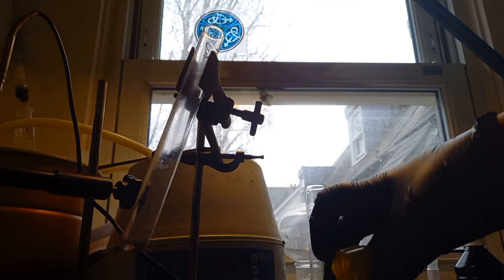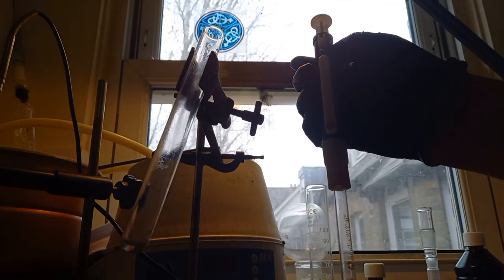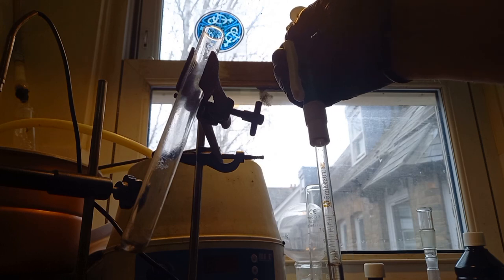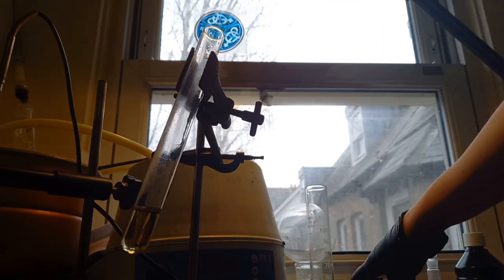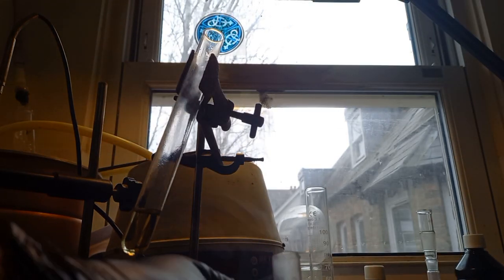A pair of gloves here — working with ethylenediamine. We just want to... I don't know exactly what we got here, maybe a bit less than that. About two to three milliliters.